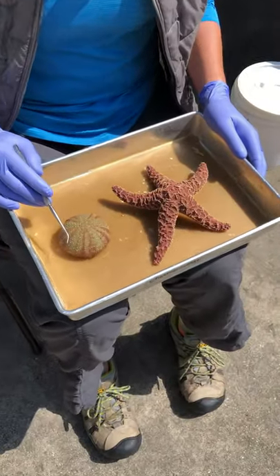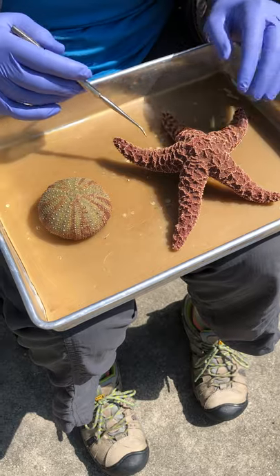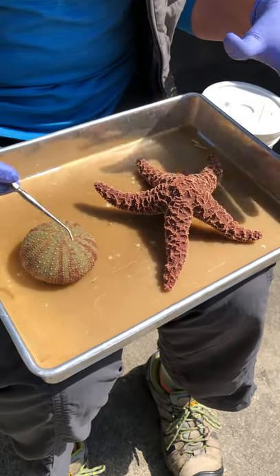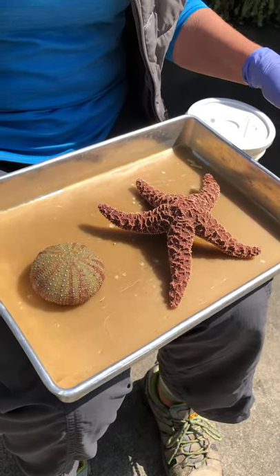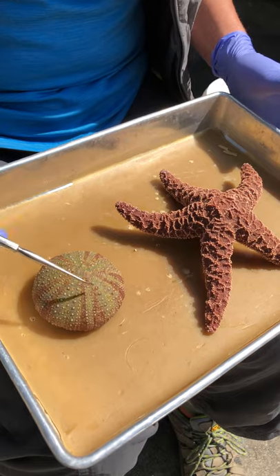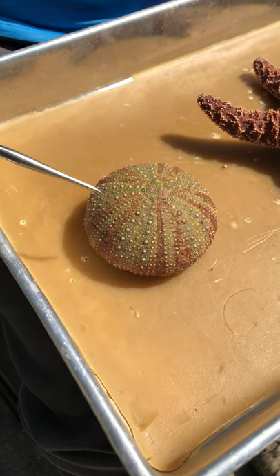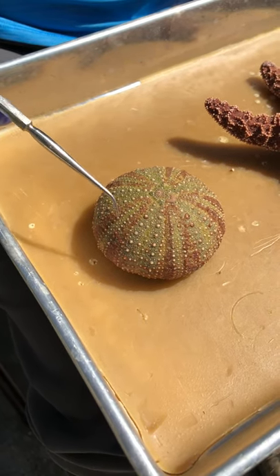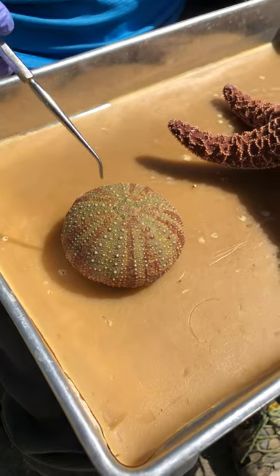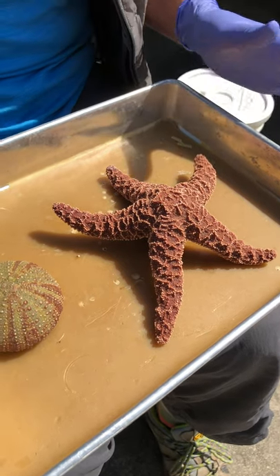The two Echinoderms on your assignment for dissection are the sea urchin and the sea star. What they both have in common is that, for bilaterally symmetrical animals — bilaterians — they have this kind of crazy, not bilateral symmetry. It's radial, and it's called pentaradial. Even on the sea urchin, although it's explicitly round, the patterning evident on the skin is in patterns of five: one, two, three, four, five. That's going to be true in all Echinoderms — five or multiples of five — and it's really conspicuous in the sea star with its five arms. Some sea stars have 20 arms, so it's five or multiples of five.